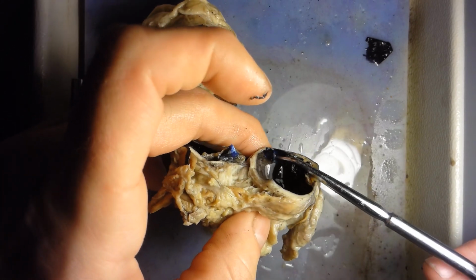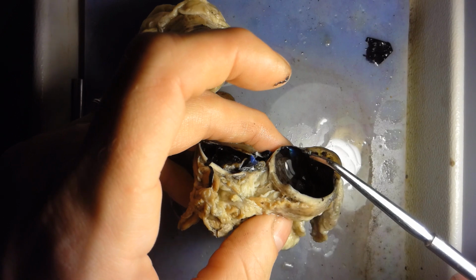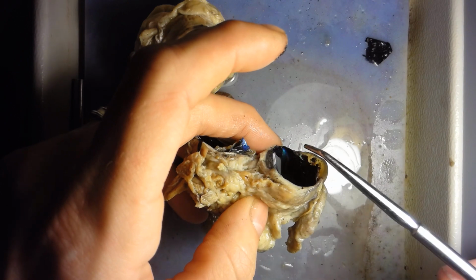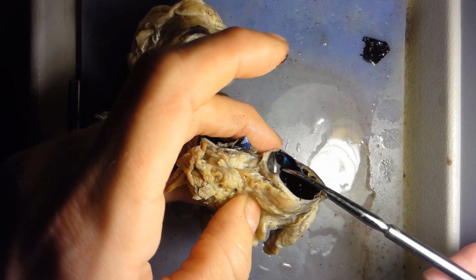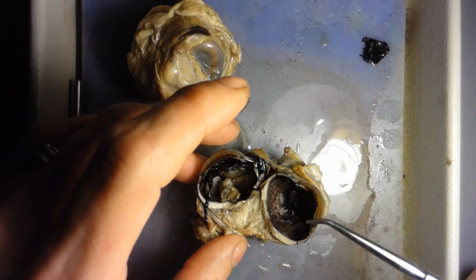We don't have it because our eyes don't reflect at night when a light is shining in them. Think of deer eyes. Deer have it, and it allows their eyes to reflect light in the dark, and sheep have it as well. So it's this reflective nature. That's the choroid coat, which we call tapetum lucidum in animals like the sheep and deer.